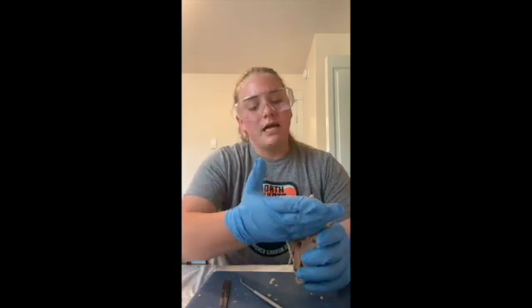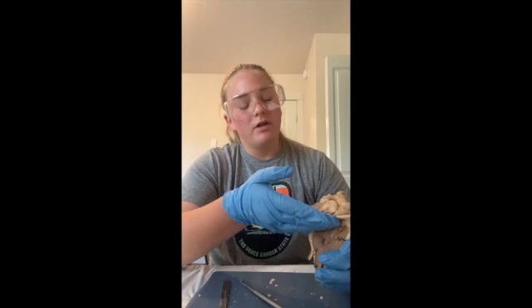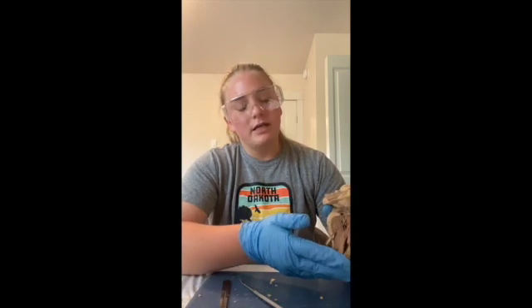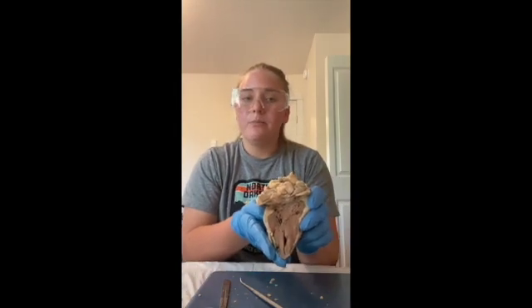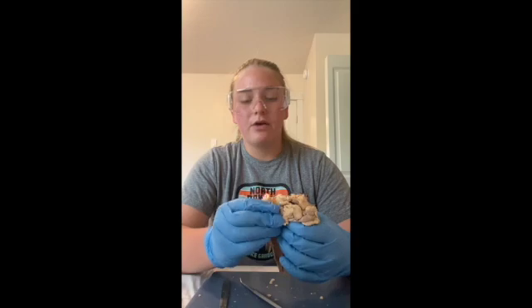So this is the base, this is superior, and this is where major blood vessels emerge from. And then we have the apex, which is inferior, and as you can tell, the tip points left a little bit. All right. Next, we're going to talk about the auricles.